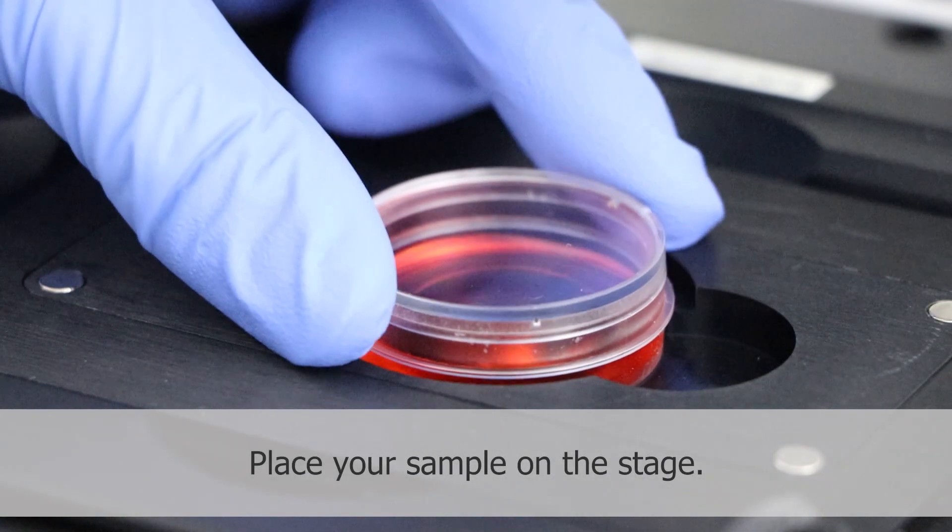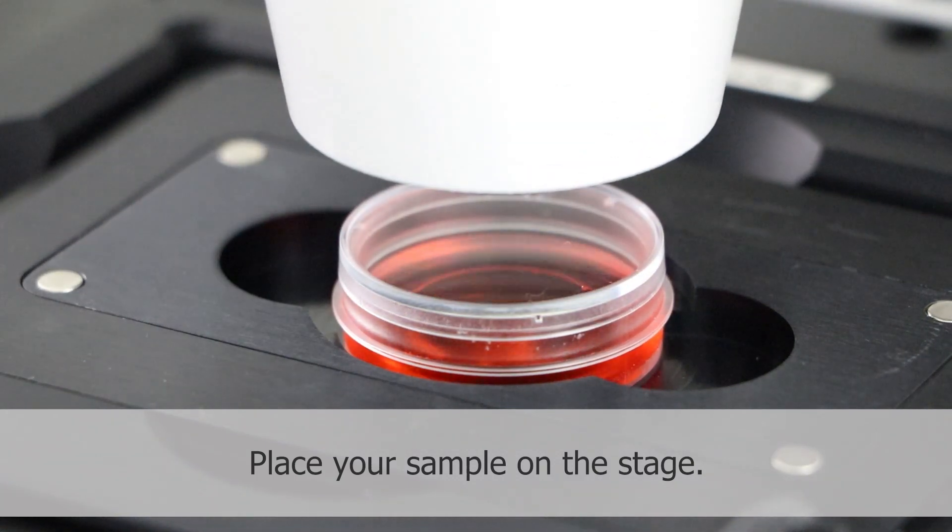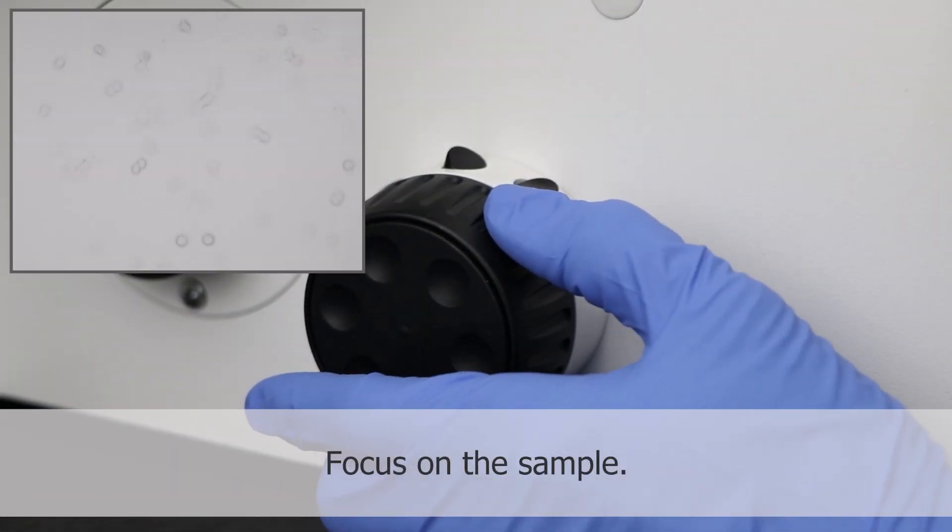Place the sample on the stage of your microscope. Put the sample into focus using the focusing knob.